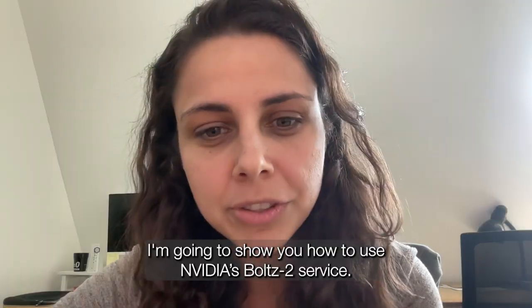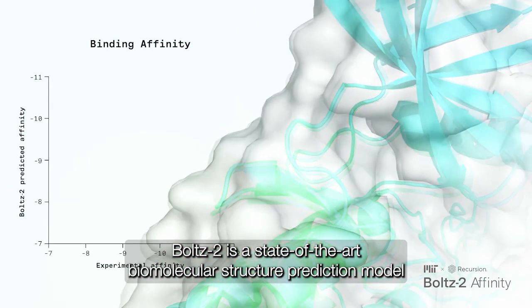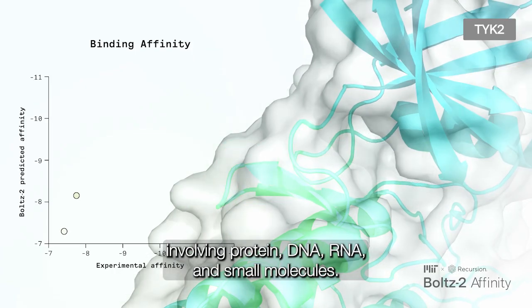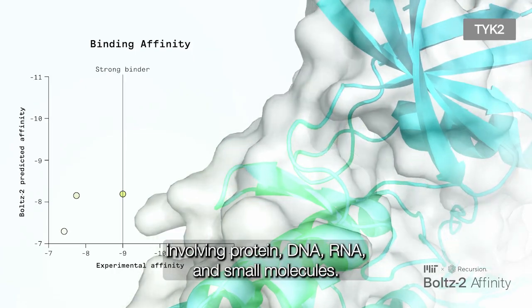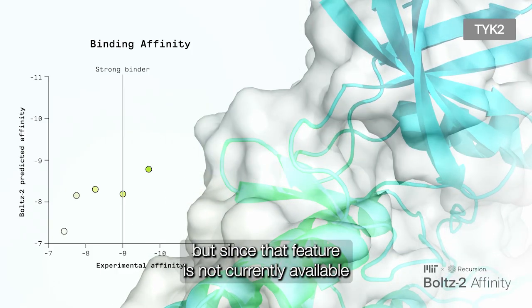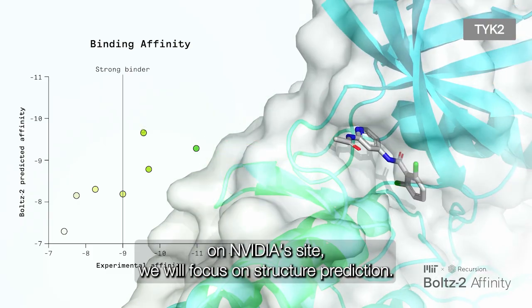I'm going to show you how to use NVIDIA's Boltz-2 service. Boltz-2 is a state-of-the-art biomolecular structure prediction model offering fast, high-accuracy structure predictions for complexes involving protein, DNA, RNA, and small molecules. Boltz-2 is especially suited for predicting binding affinity, but since that feature is not currently available on NVIDIA's site, we will focus on structure prediction.